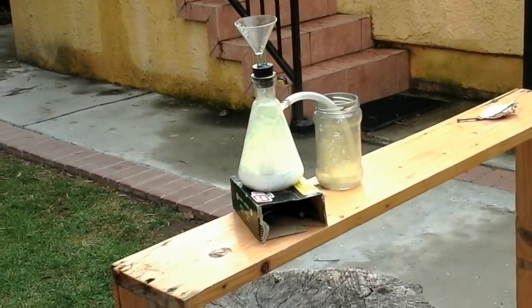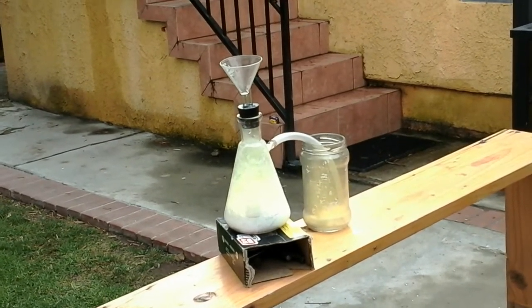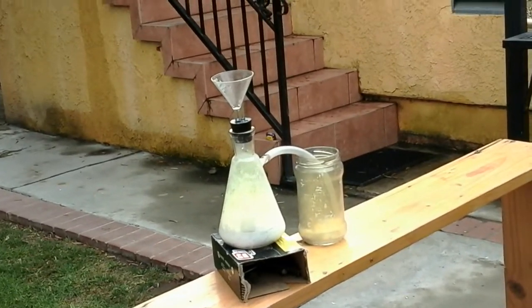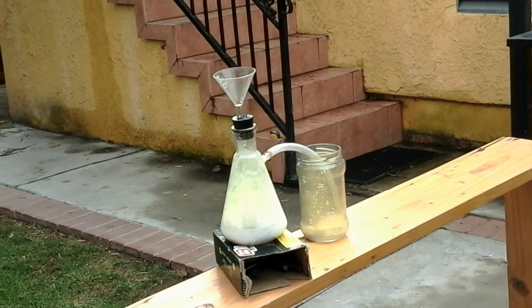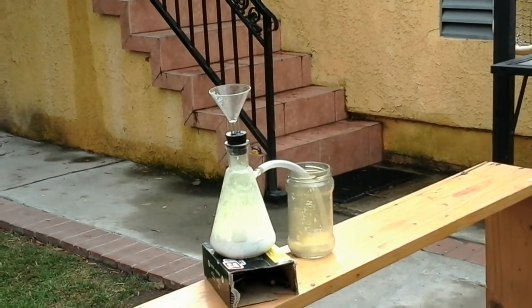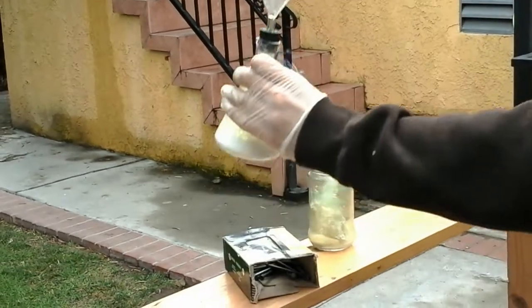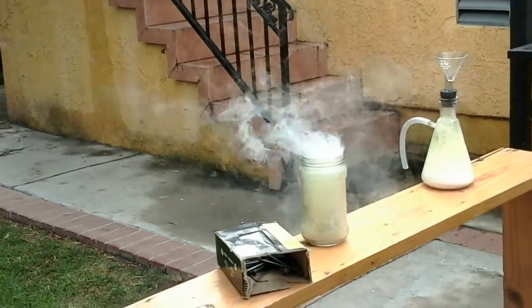I'm going to show you a reaction with chlorine. If you're into chlorine videos, you've probably seen this reaction before — the aluminum reaction. Essentially you just get some aluminum and you're gonna get aluminum... I forget the name. And there you have it.